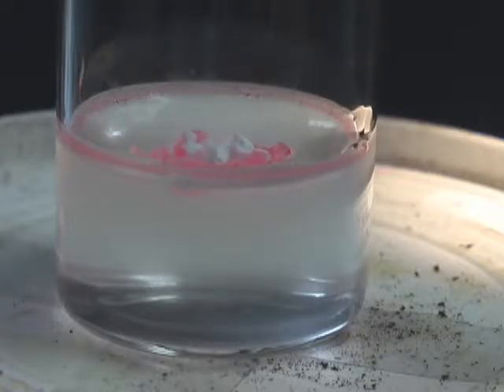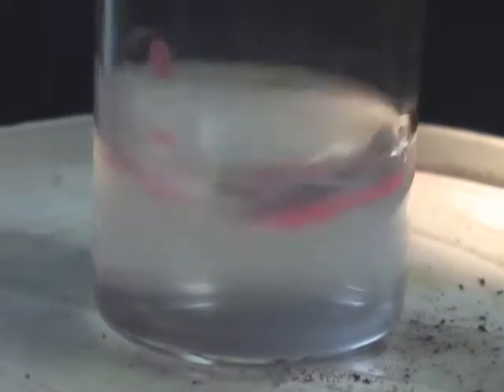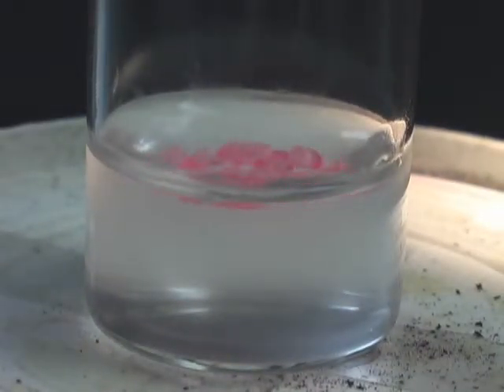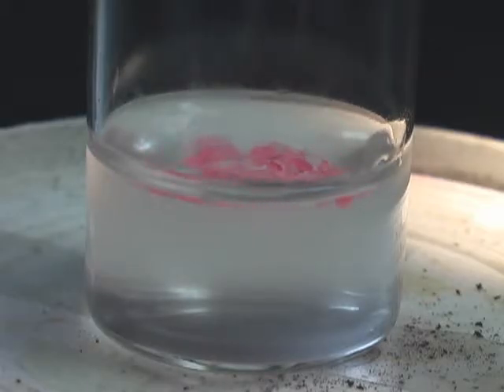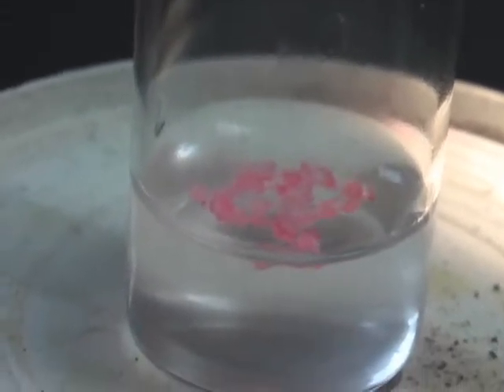We will again simulate waves in the water through shaking the beaker. After a short time, when we stop, you can see that the emulsion has been absorbed by the nanomaterial, and the nanomaterial has changed color. This represents the completion of the cleaning process.